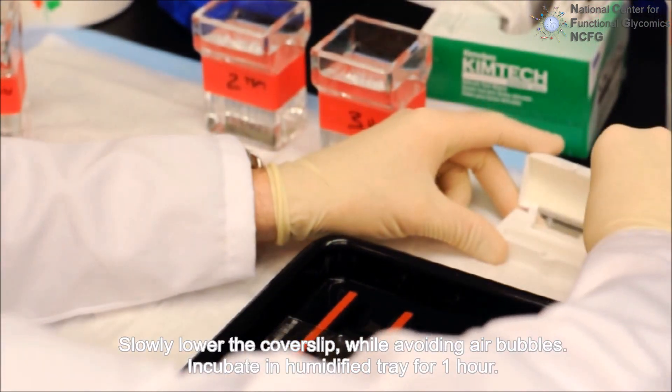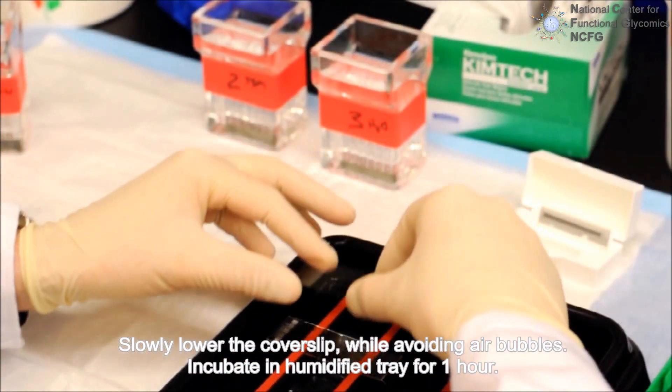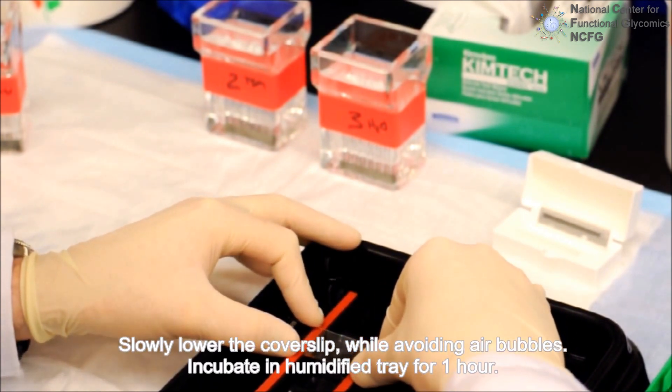While avoiding air bubbles, slowly place a cover slip onto the slide and incubate in a humidified tray for one hour at room temperature.